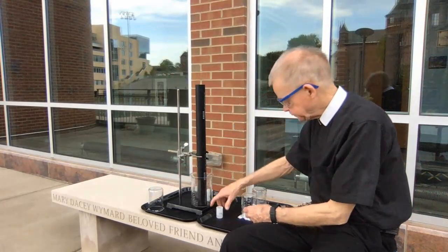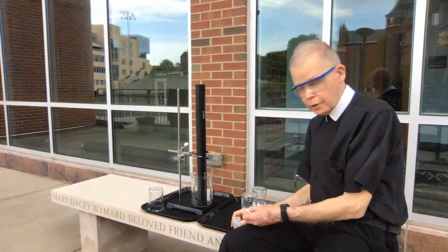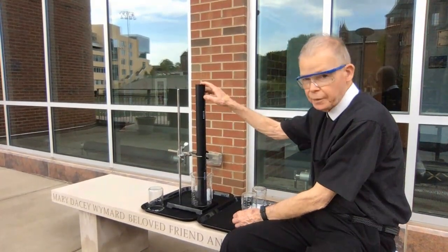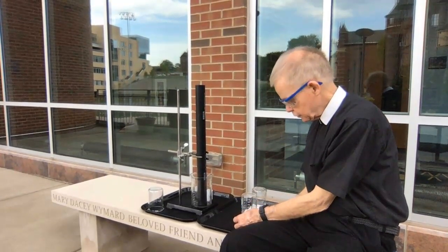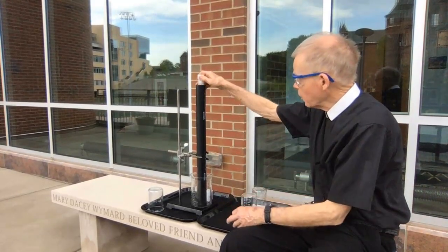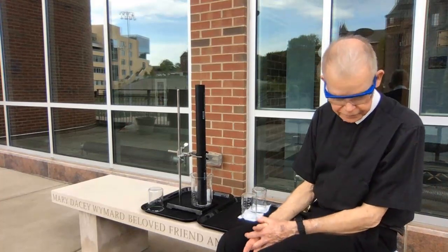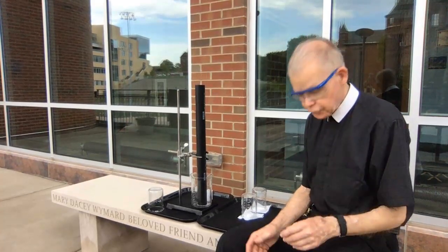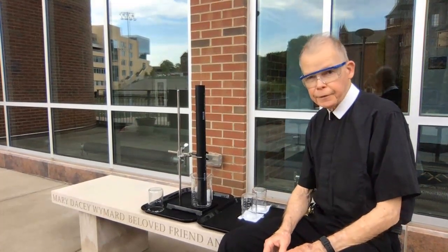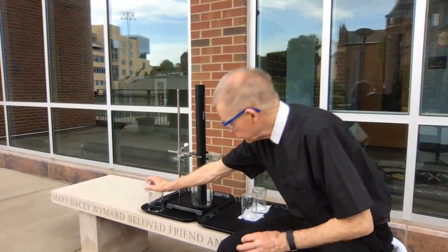Put that beaker aside. Here's my 10 milliliters. And what I'll do is I'll drop it in real quick and then drop it upside down into the tube. And then we'll see if we get a reaction. Shake it a little bit, drop it in. Oh yeah. It landed about 2 inches away from my computer here. That's our first reaction. That was the one done with 10 milliliters of vinegar and 1 gram of sodium bicarbonate. So let me put that one aside.